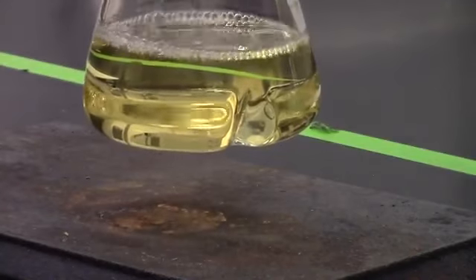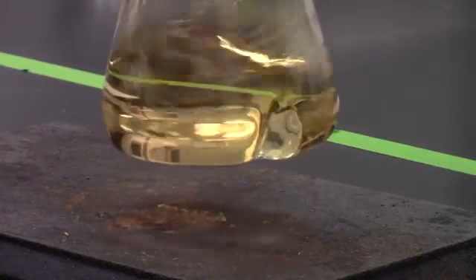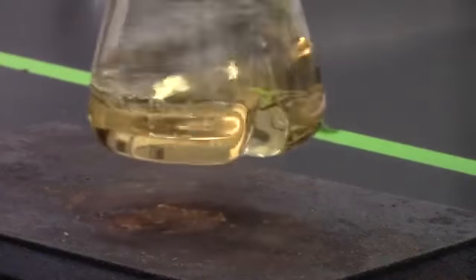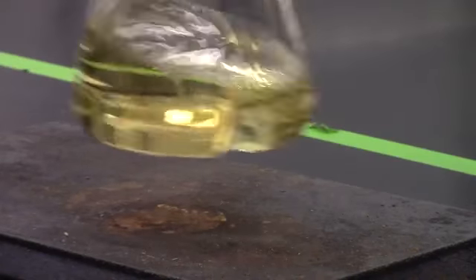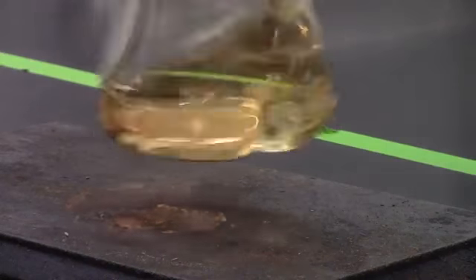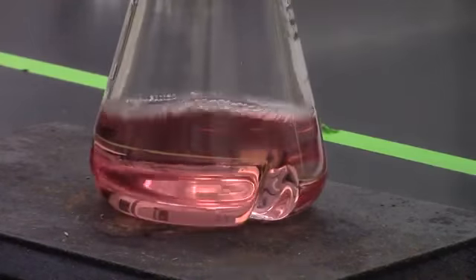This works because the potassium hydroxide is a basic solution, which reacts with an acidic solution until all of the acid is consumed and the solution is neutral. Any potassium hydroxide added to the sample after it is neutral causes the solution to become basic and change color.